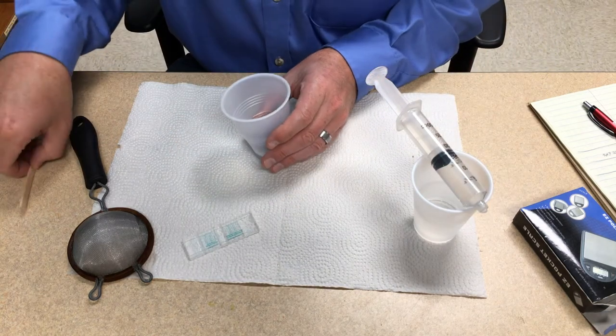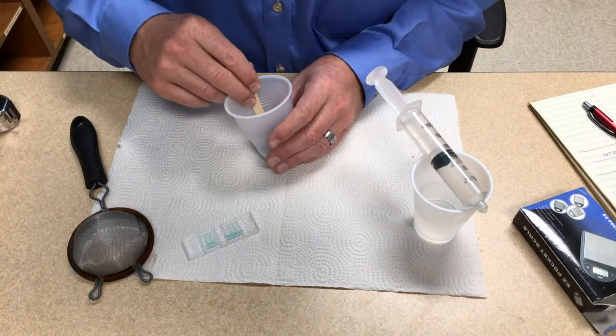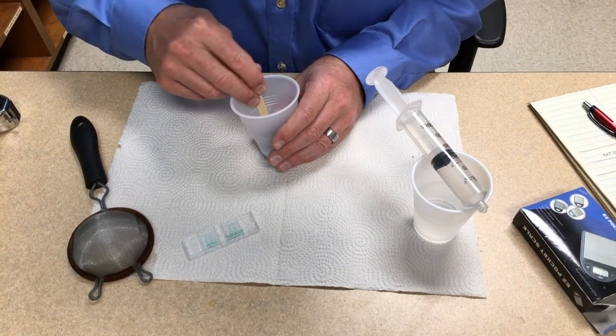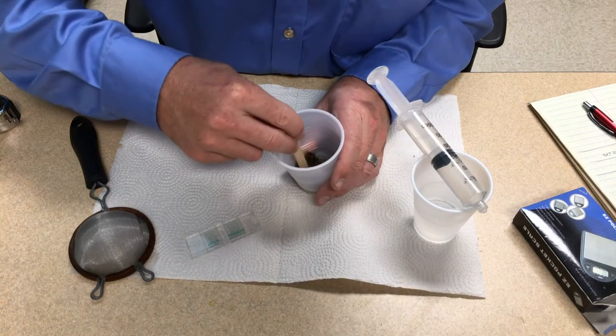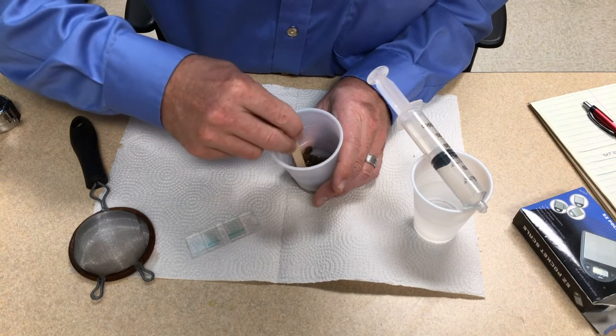Then using your popsicle stick, you want to thoroughly break apart those pellets. For this purpose, it's nice to have a cup that has ridges on the sides.